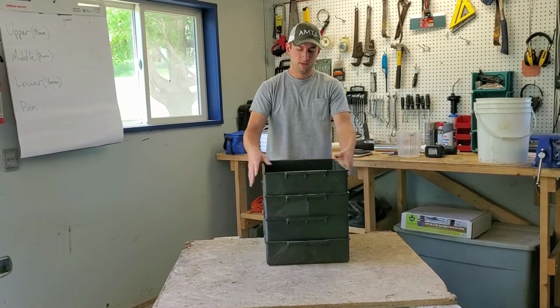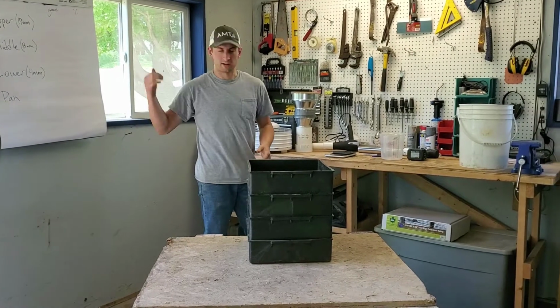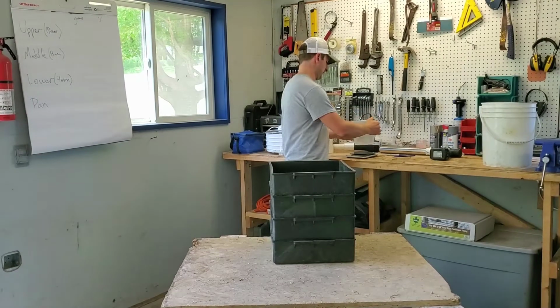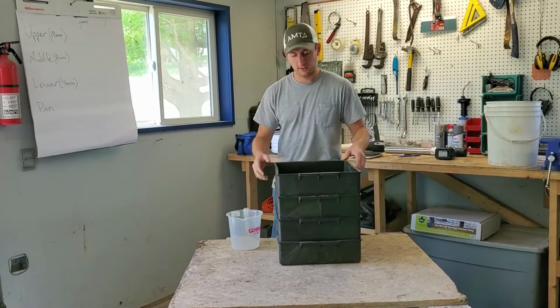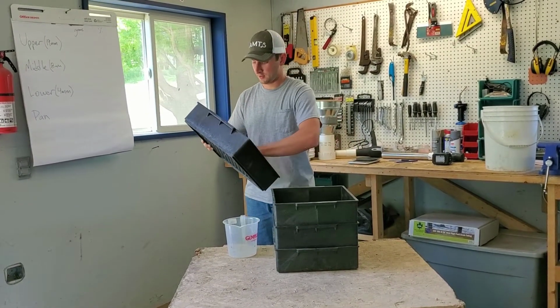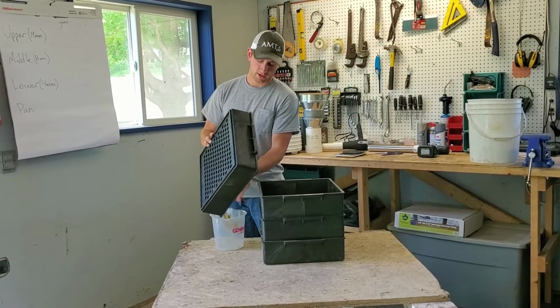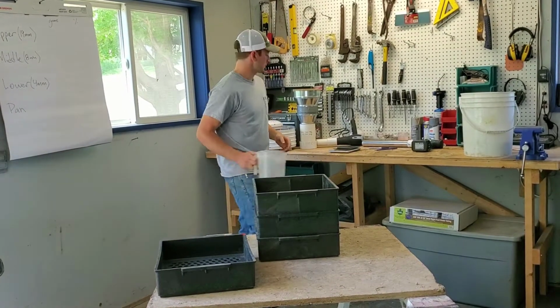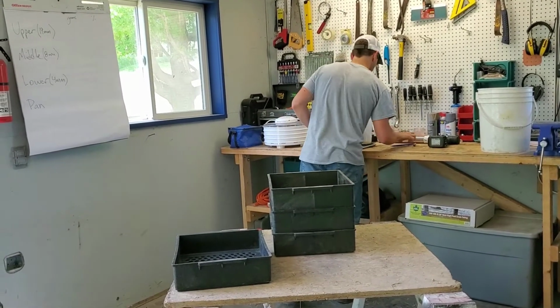All right, and we're done. Now all we've got to do is weigh what's retained on each of the different sieves and write it up on our board here. So I'm going to take my cup, make sure it's empty, make sure it's zeroed on the scale, and then all I need to do is bring all my particles to one corner, try to make sure they don't fall through, and try to get as many as you can into the container. So, here we have 10 grams.